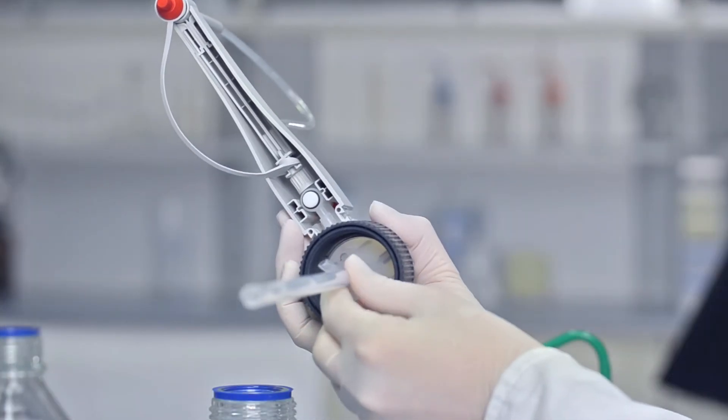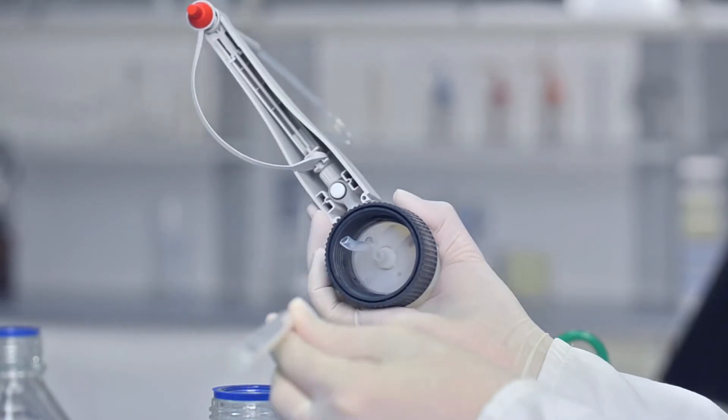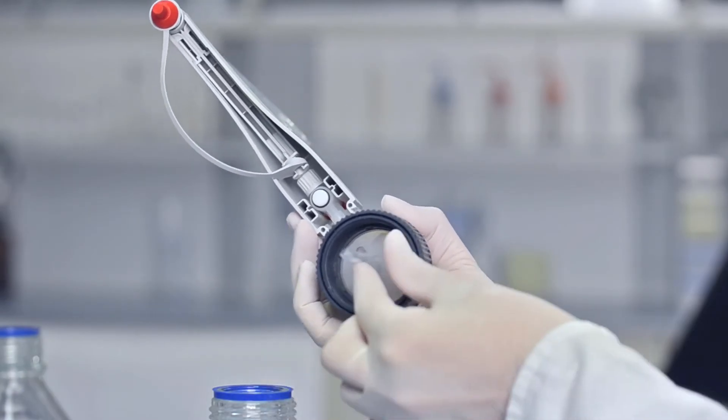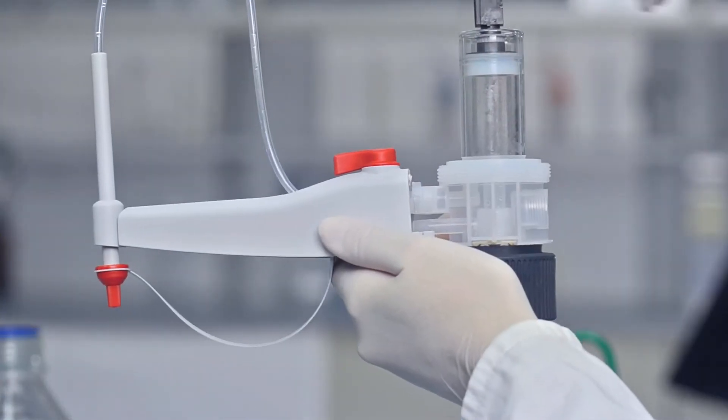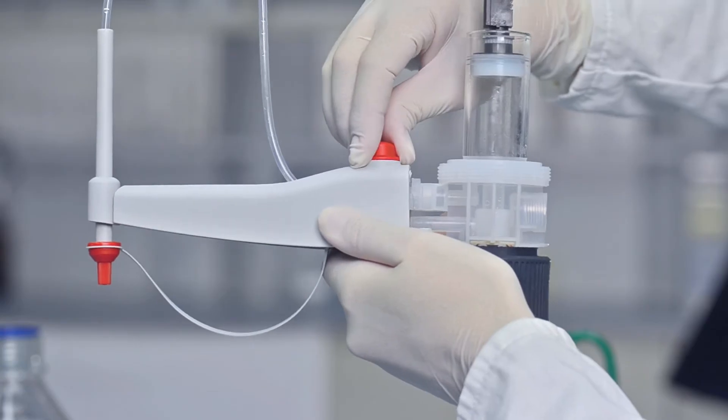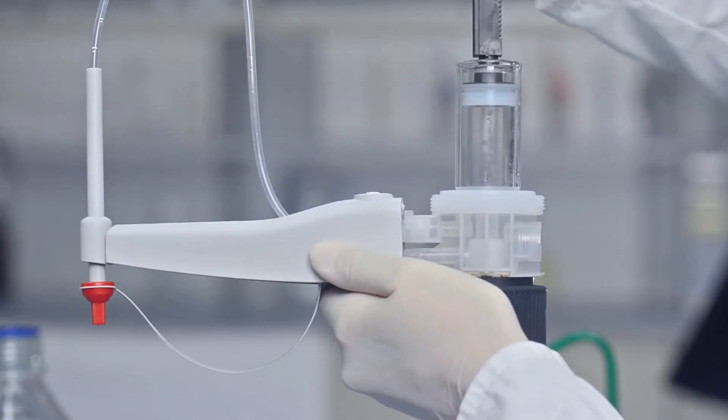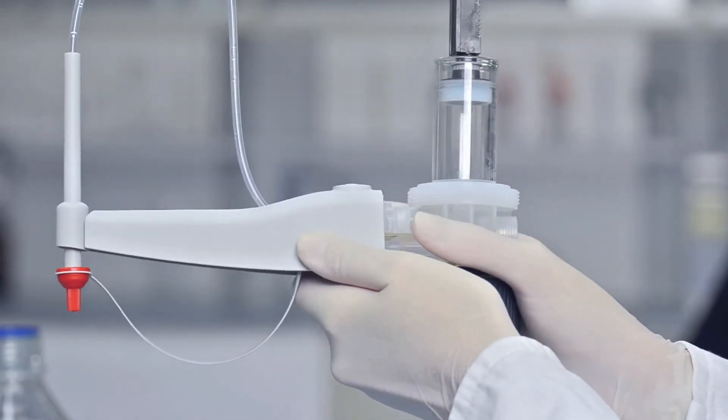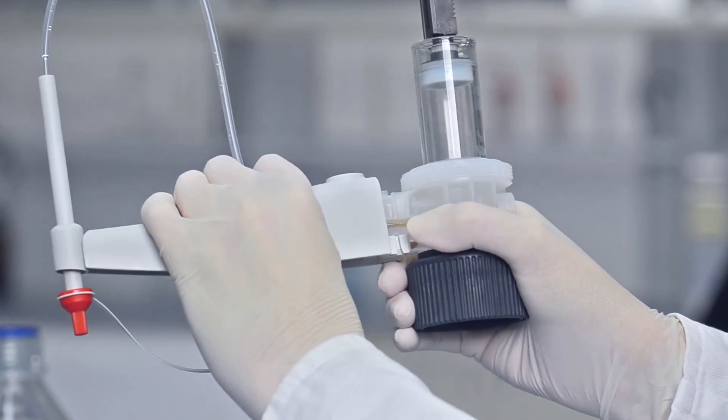Pull out the filling tube and the recirculation tube. Then set the valve to recirculate and pull the valve lever upward. Now the titrating tube can be removed as shown.